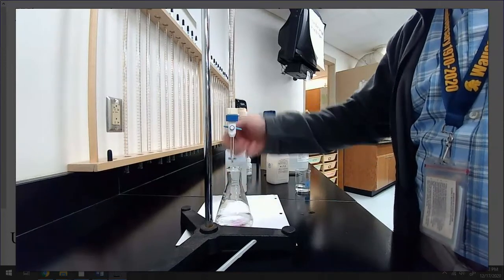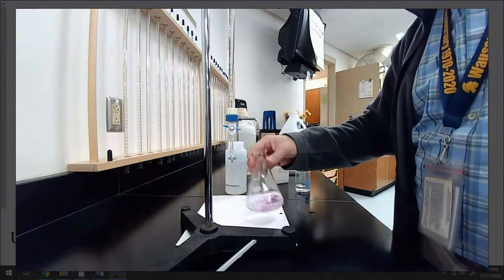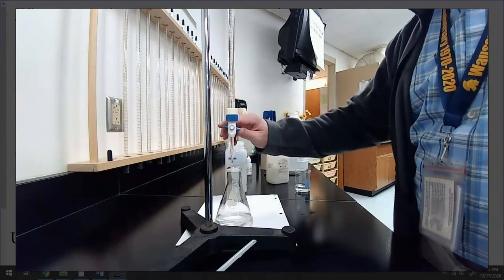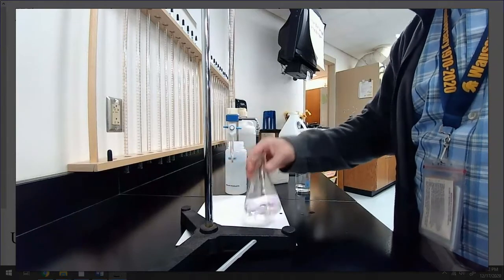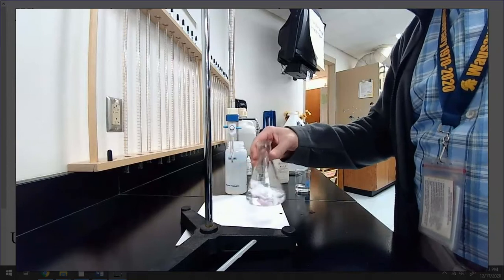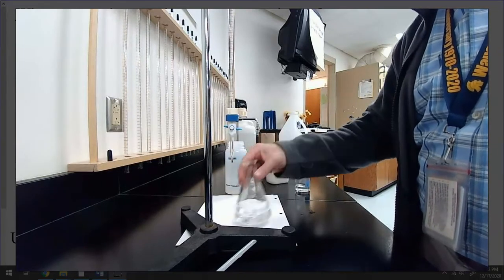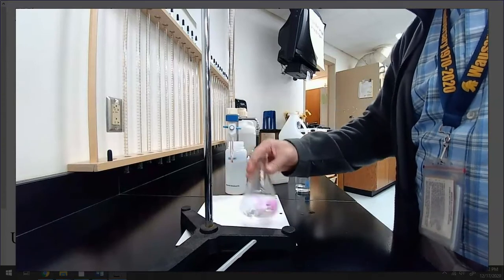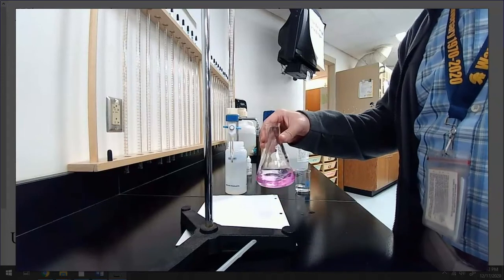Don't worry, I won't make you watch this every trial. Maybe I should. Oh, so close. Oh. There we go. Now, don't let the color fool you, okay?